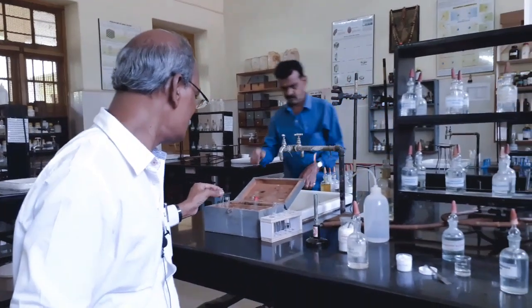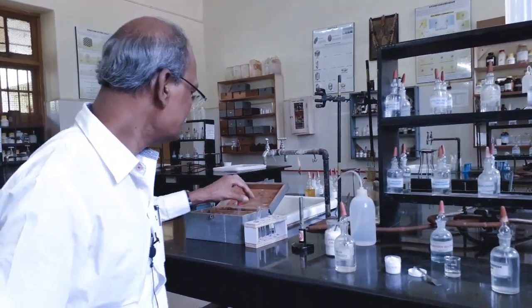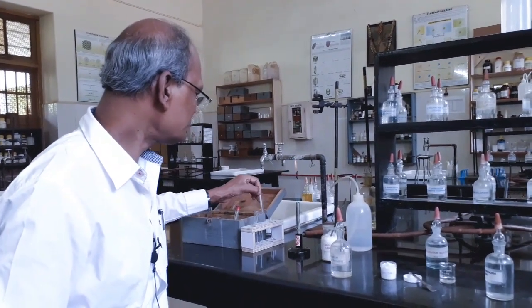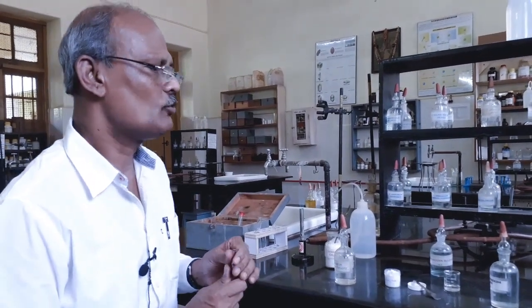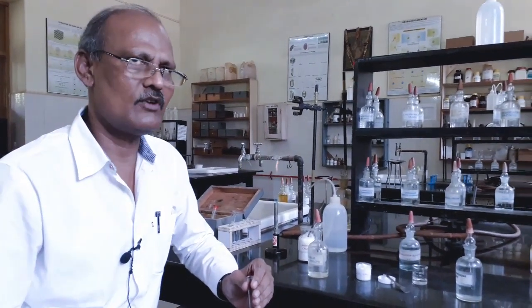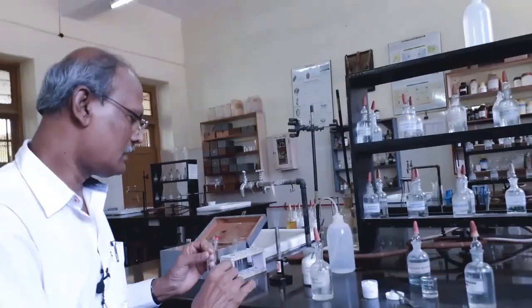Now I proceed to the next group, that is sixth group basic radical. The sixth group basic radicals are magnesium, ammonium, sodium and potassium. We have to carry out the analysis in this order only. First for magnesium; if it is absent, then we have to do the test for ammonium. If that is absent, we are supposed to carry out a test for sodium and potassium. First I carry out the test for magnesium.